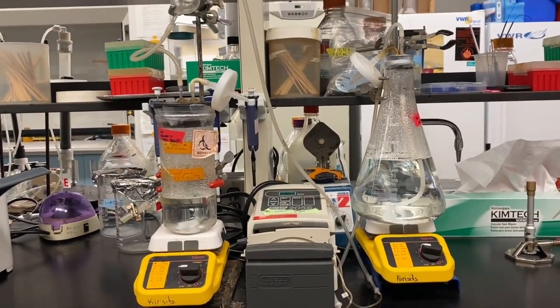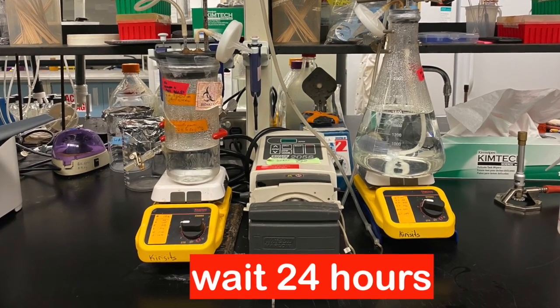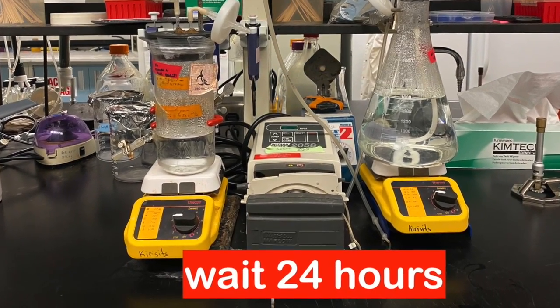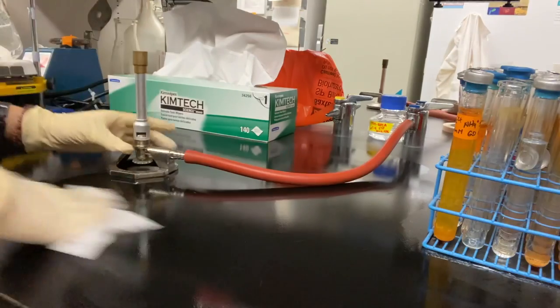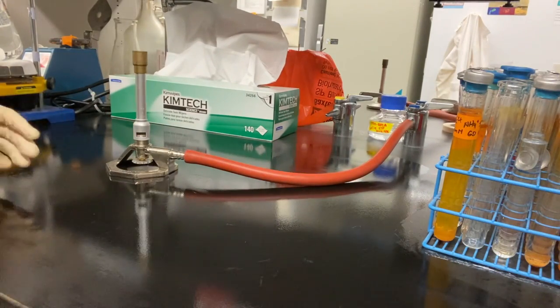At this point, there is no bacterial growth and the chemostat will sit for 24 hours to ensure no contamination. After 16 of the 24 hours have passed, we can now create an inoculated liquid culture of our target organism from the streak plate we had created earlier.